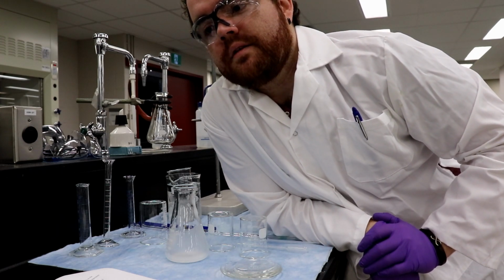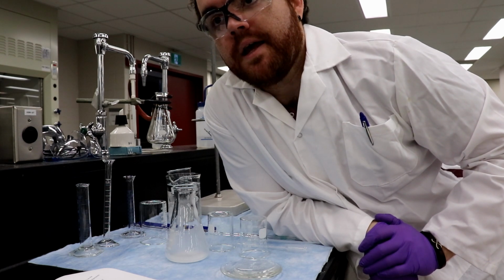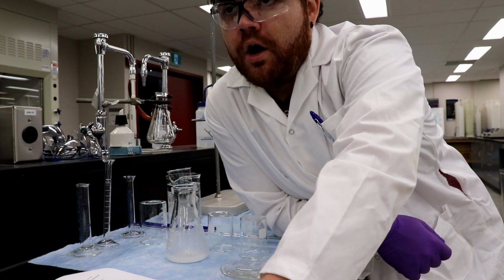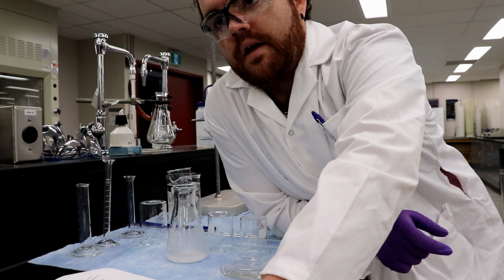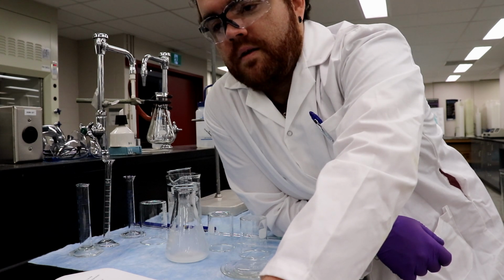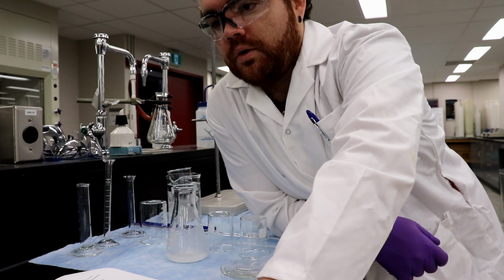So that's just the mass of SA. Yeah. And then when I put the boat back on, it maintains the tare. Okay, that's what I missed. It maintains the tare, and then basically when you weighed it, that's what's left on the boat. Got it. So you do 1 minus 2, you get 3. Okay. Cool.